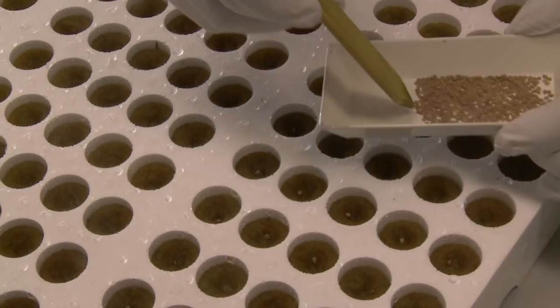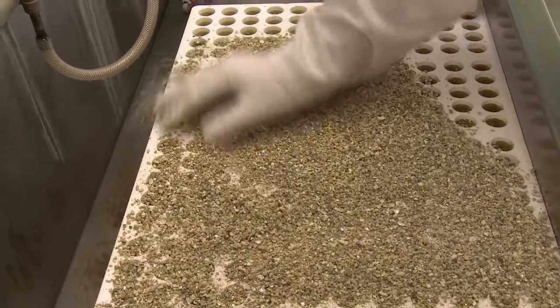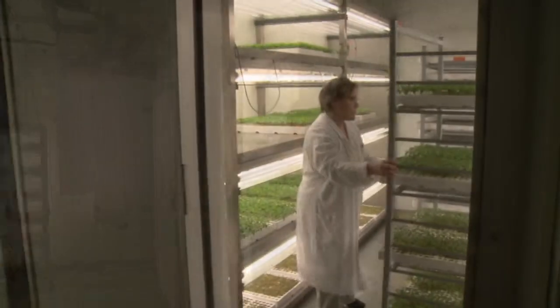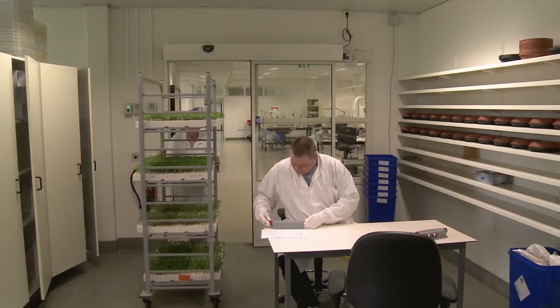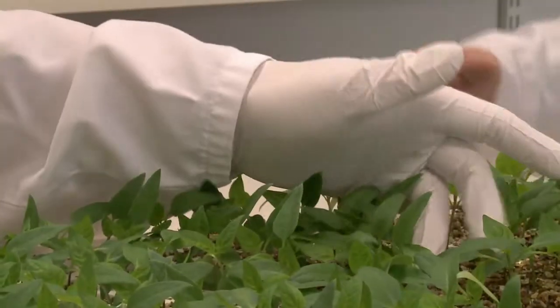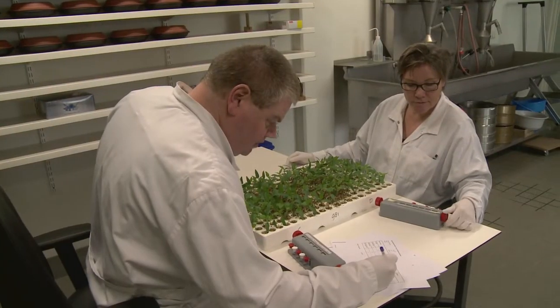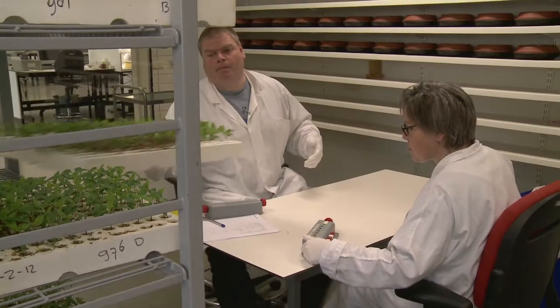Since the germination power cannot always be translated to practice, a usable plant test has been developed in cooperation with the sector. After a prolonged period of germination, seedlings are assessed for the presence of well-shaped seedlings with first leaves. The percentage of usable plants gives the propagator or grower a more practice-related indication of the quality of a certain lot of seeds.